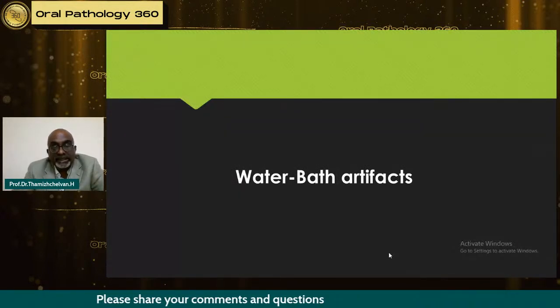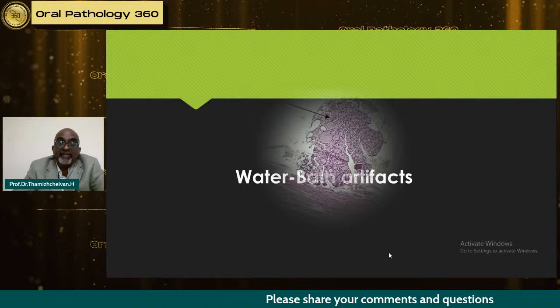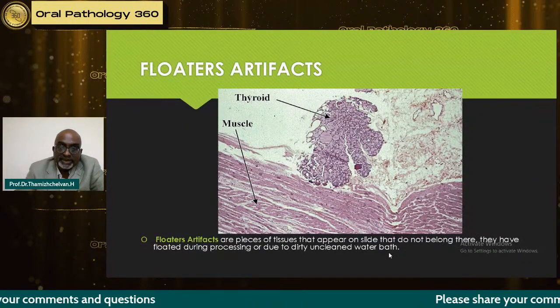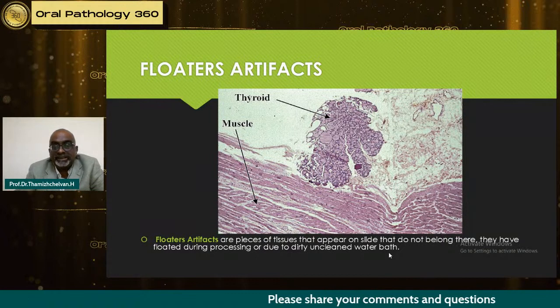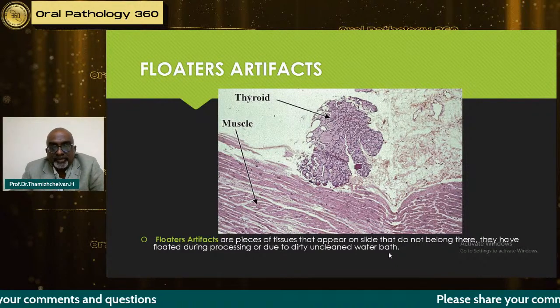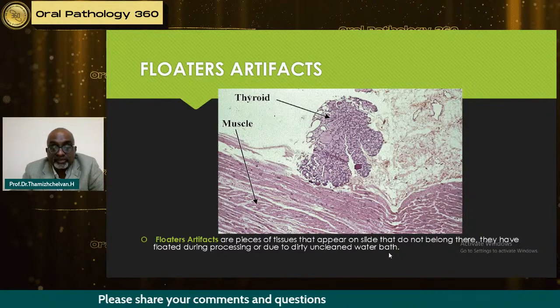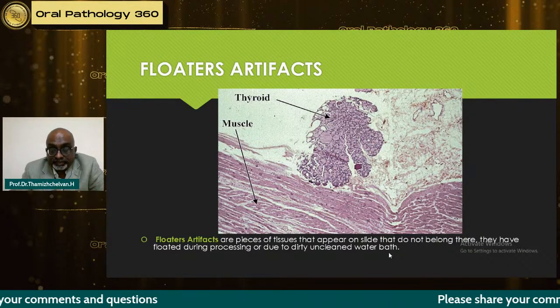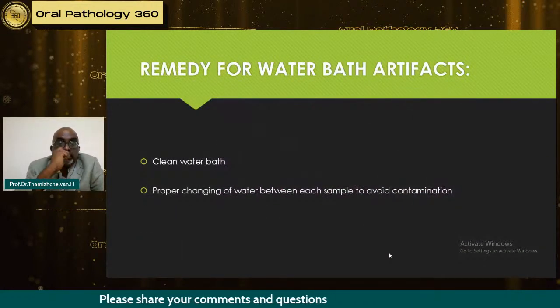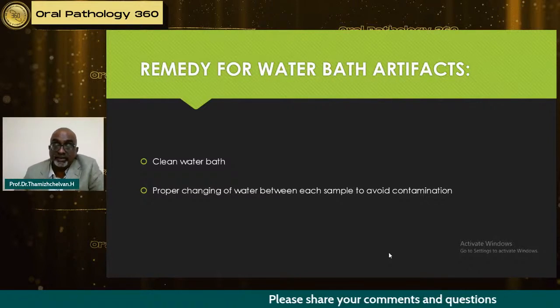Now it comes to the water bath. We think that everything is done. No, artifacts can also happen from the water bath. What are they? We have floater artifacts, because when technicians don't have time, they keep continuing with the specimens. Look at this case here. We see a thyroid tissue which is not completely relevant, and this picture was taken from the net. So in our profession, in oral pathology, when we get such a tissue, we will start thinking of something like metastatic carcinoma, which can make the life of the patient miserable. So it is said that the water should be changed after each specimen to avoid floater artifacts. Please instruct the technicians to clean the water bath regularly and change the water between each sample to avoid contamination.